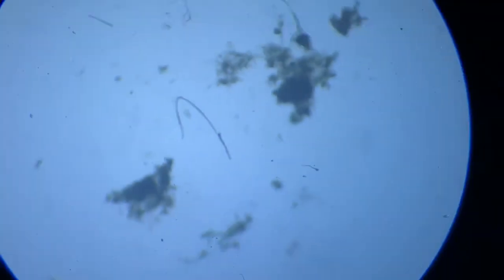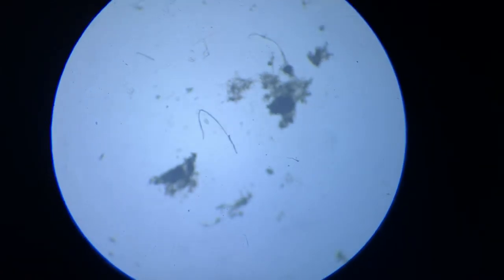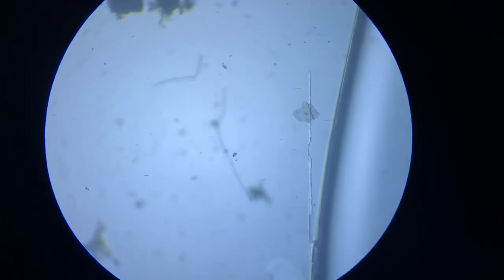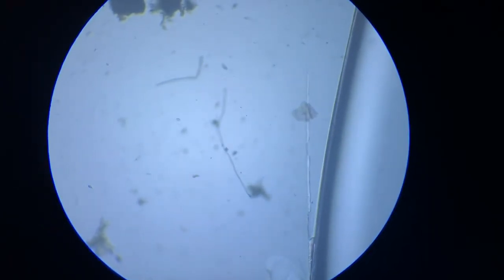So thank you for being so patiently watchful of this, and I request you to please share with me if you have any understanding about this particular worm. I'm calling it worm because it looks like a worm. And I'll be glad if anybody can give me a clue about what exactly this organism is, so that I can probe further about its biology.